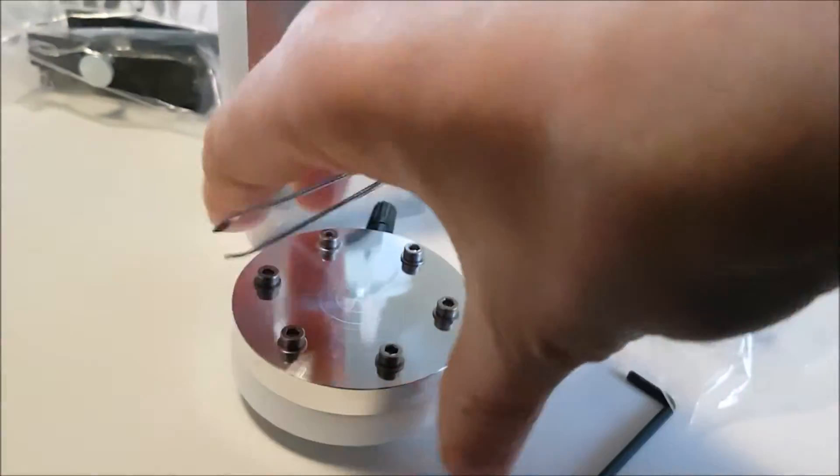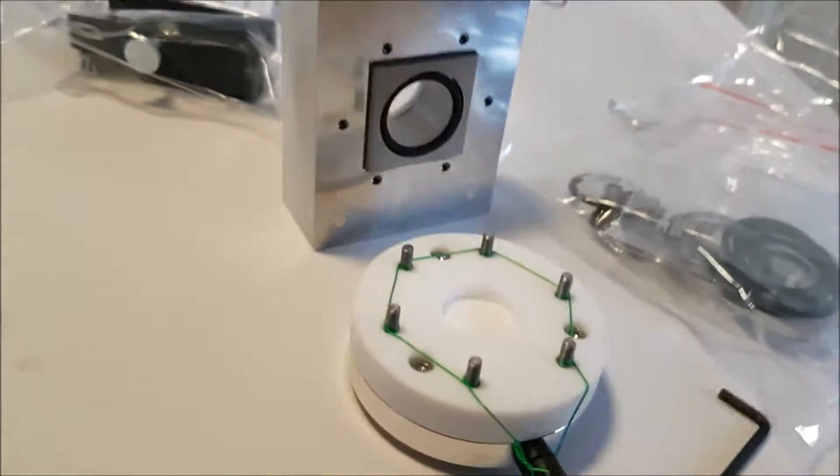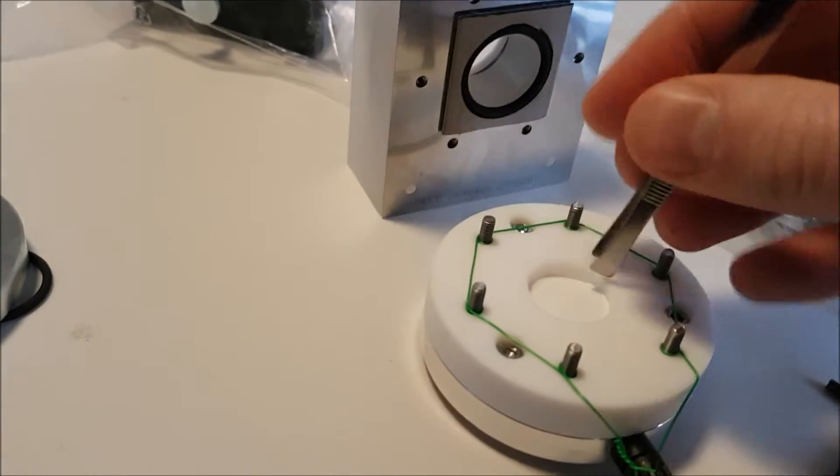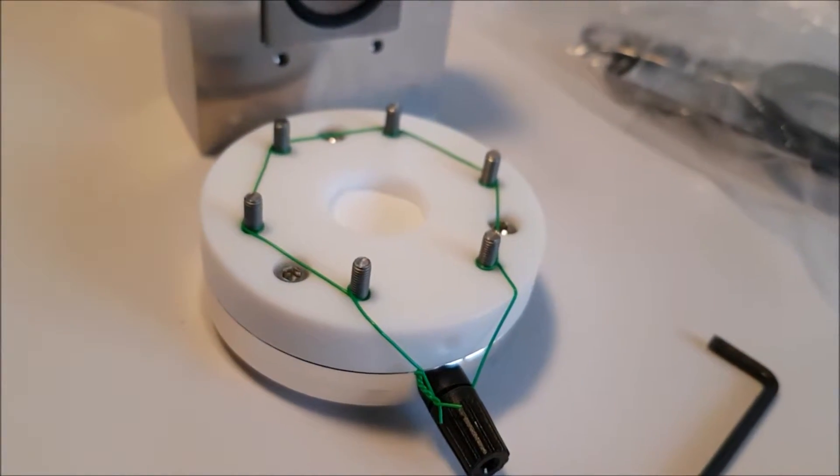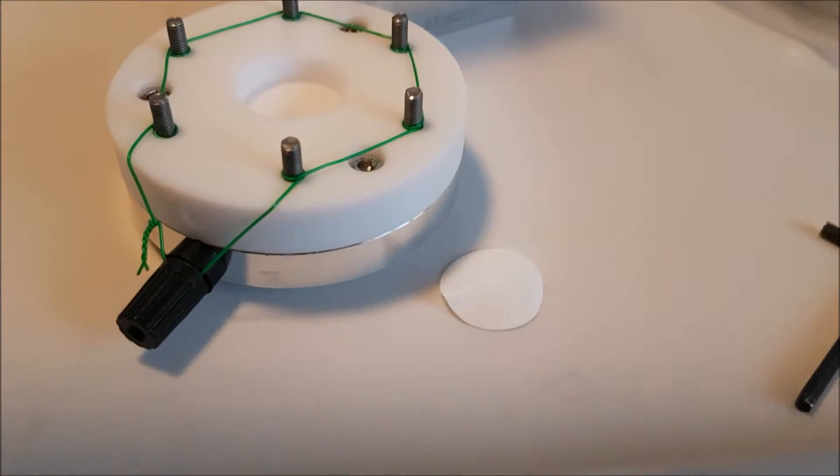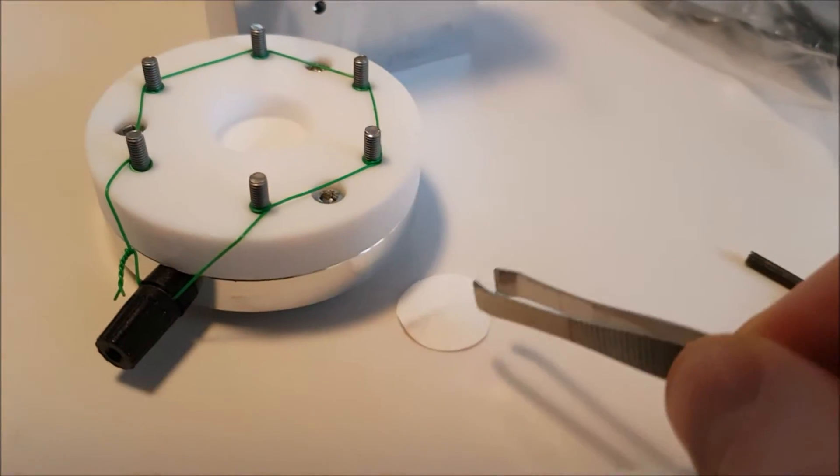So I'll tip it back out again. I'll have to get something in there, I'll just pull it out now. I'm going to have to use two fingers for a sec to get this out. Alright, so I have to use two fingers to get that out.